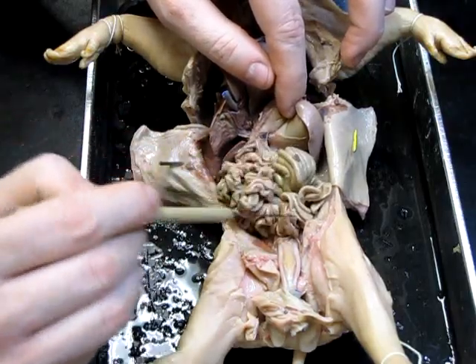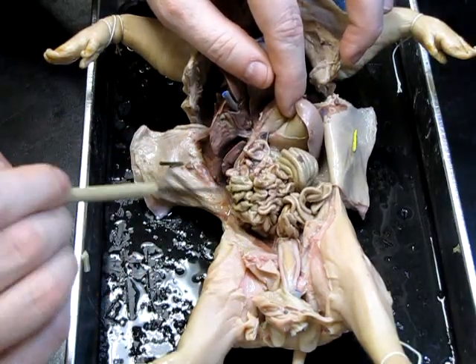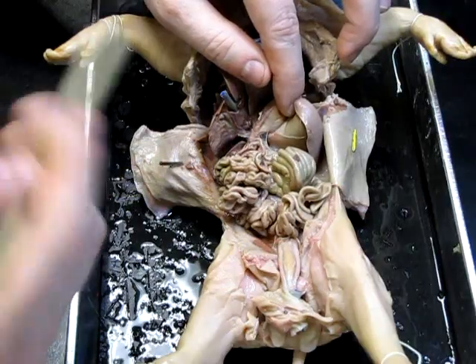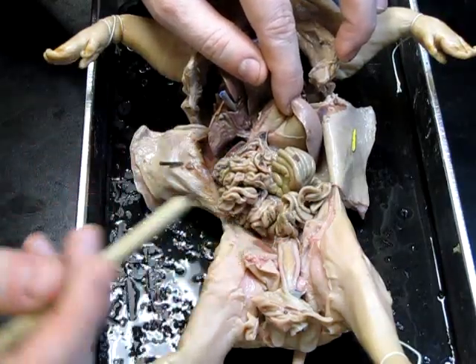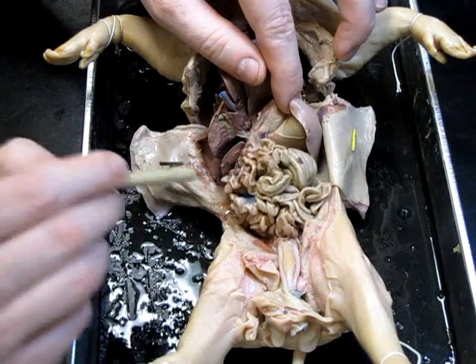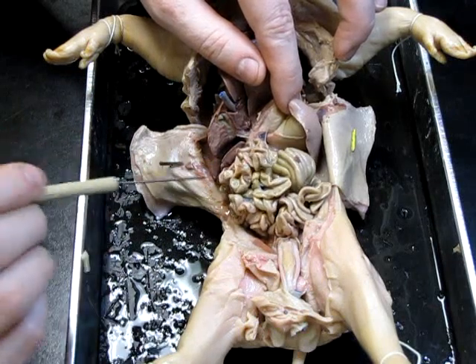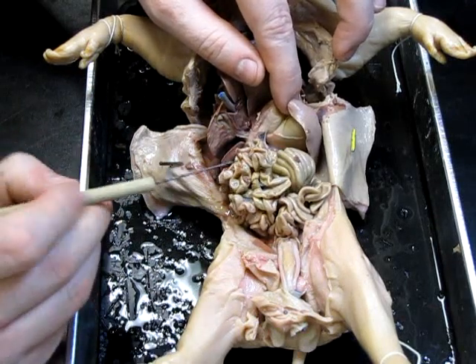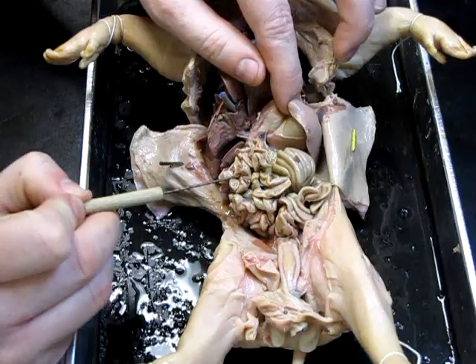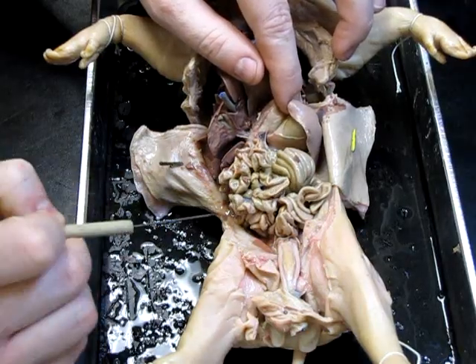The small intestine is actually very, very long when it's all stretched out. The name sounds a little bit deceiving because it seems incredibly long, but the name refers more to the diameter or circumference of the intestine, and not its length.